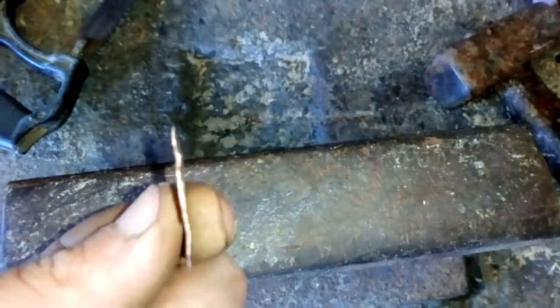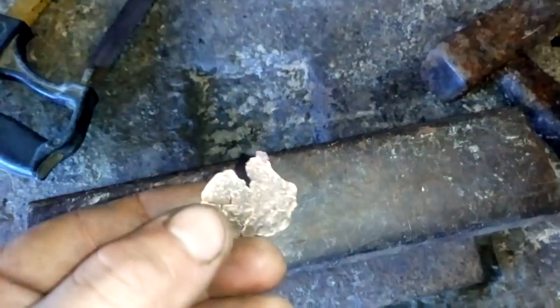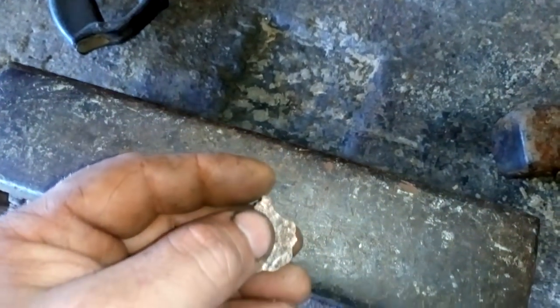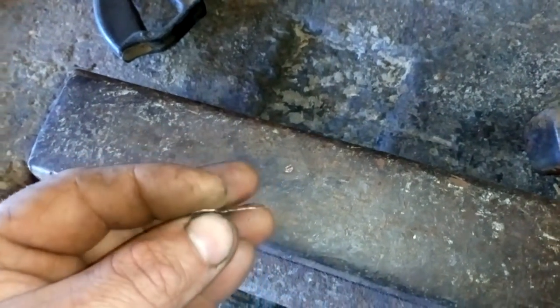Okay, after only a couple of minutes you see we got a nice little tiny piece just like foil, but it's very very tiny and you see it's full of cracks. So actually I don't expect too much pure gold from this — maybe half a gram, maybe some more. Now let's go with that in a beaker. We will crush this into little particles, and when we do that we'll put that in a beaker and try to dissolve that.